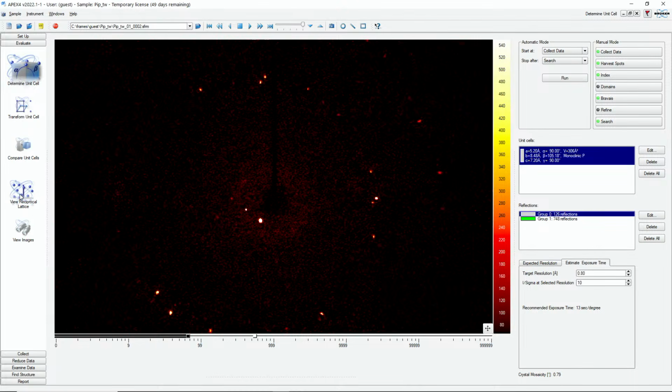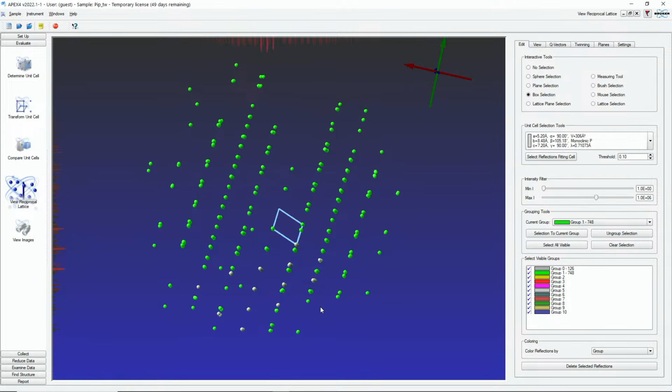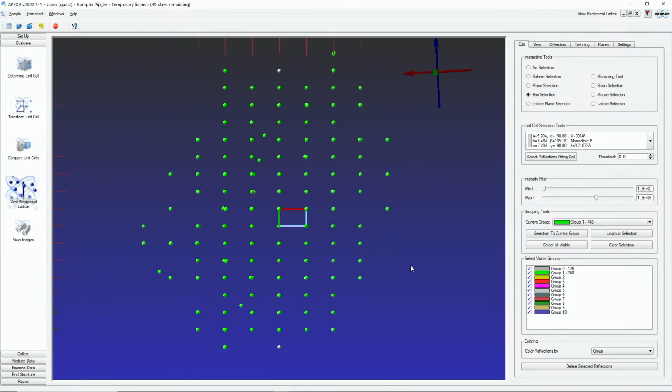Now, when we go back here, you see this is the unit cell that it has found, and it finds the right unit cell just because I filtered these out. When we press F1, we look along A star. F2, we look along B star, and F3, we look along C star. Okay, and I could see there how it was lining up with that one set of reflection lines, like you had said. So that was just to show how we indexed the first domain.